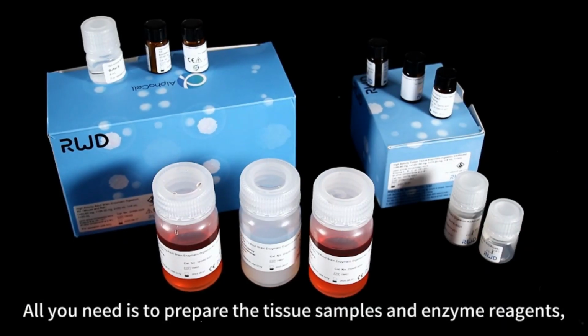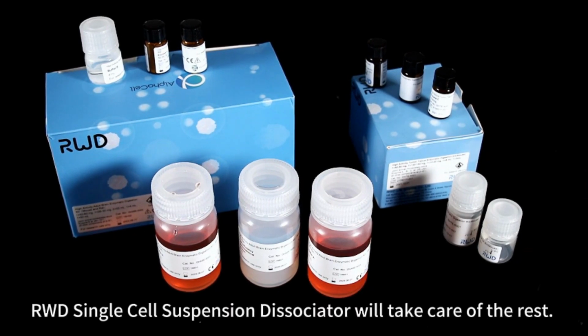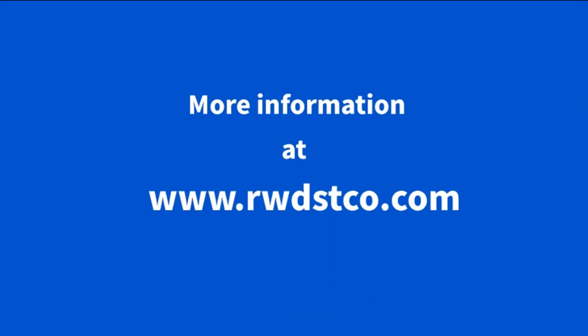All you need is to prepare the tissue samples and enzyme reagents, mix them well, then choose the suitable program and run it. RWD Single Cell Suspension Dissociator will take care of the rest. After a simple filtration with a cell strainer, you will harvest the primary cell suspension for downstream experiments like single-cell sequencing, flow cytometry, cell culture, etc.